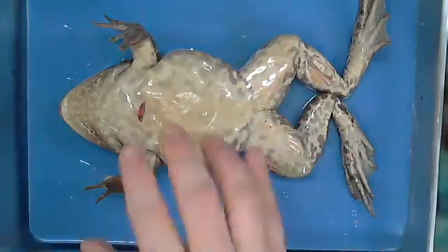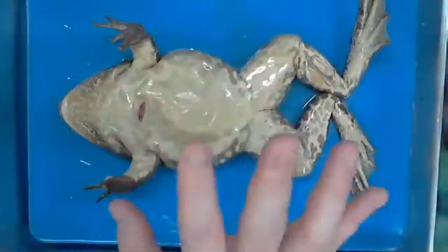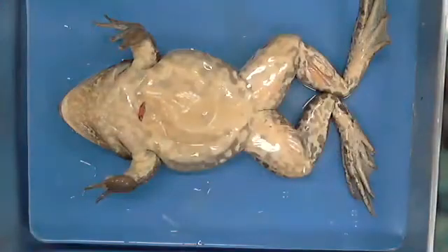He'd be real gray inside. All dead animals are going to be that way, and so they kind of preserve it. That's the reason why this is this way. Obviously, he didn't get shot in the heart, and that's what killed him at all. They do the same thing down here on the leg as well, as they're kind of trying to stain some stuff for us to see.